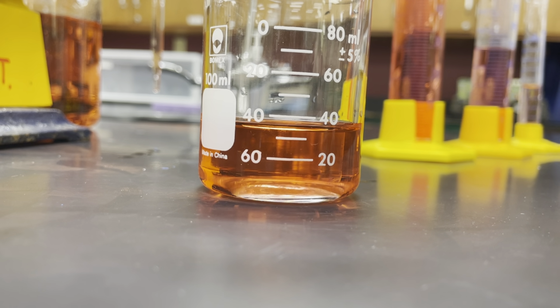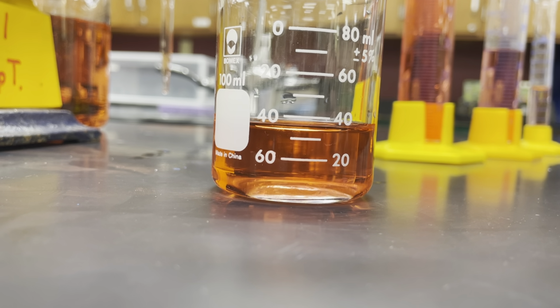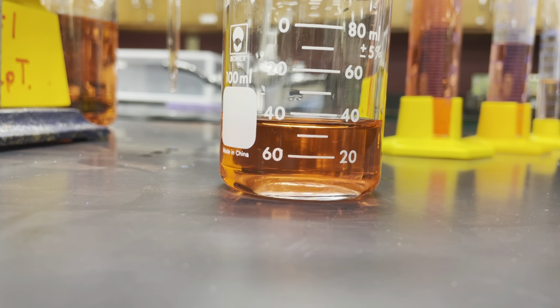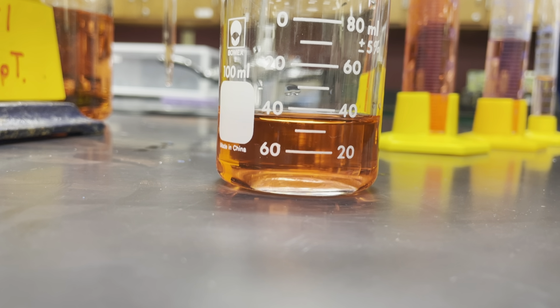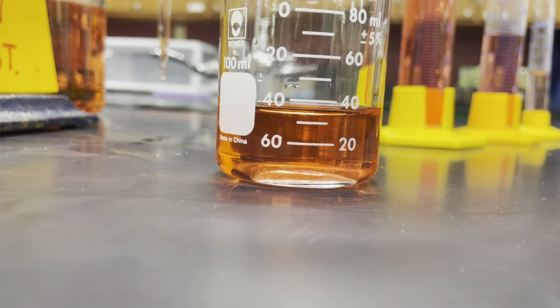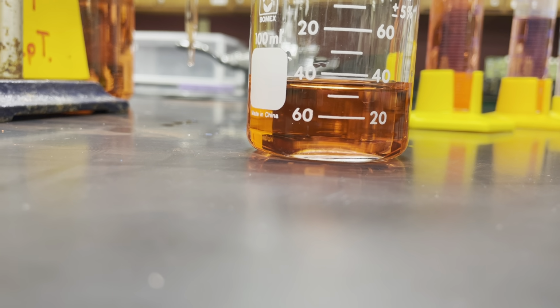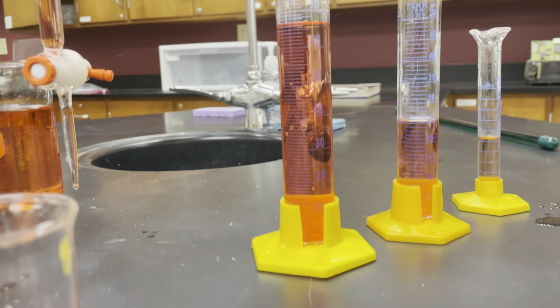In general, that uncertain digit is usually the last digit in your measurement. It usually is the last thing you have to split hairs and read between the lines on. So even though I can go between 30 and 40, and that includes the ones place, we don't really know for sure anything past that. There's nothing that allows me to figure out anything in between the ones place to get down to the tenths place. So our uncertain digit is going to be in the ones place, like the 5 of 35 or the 6 of 36. Now, depending on what glassware you use, you might have different cases of this.